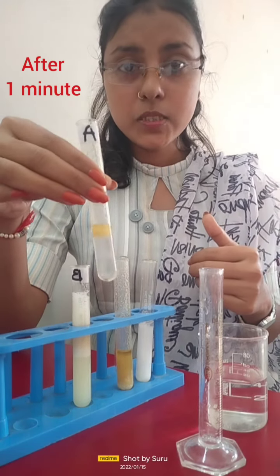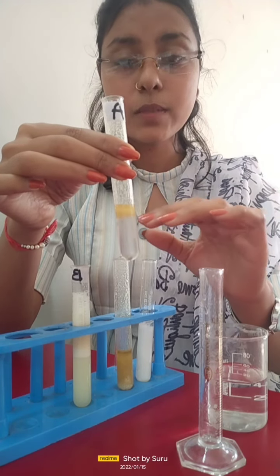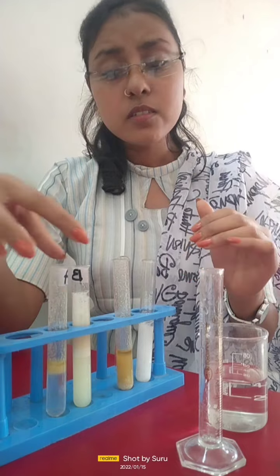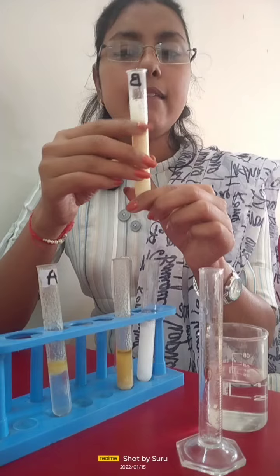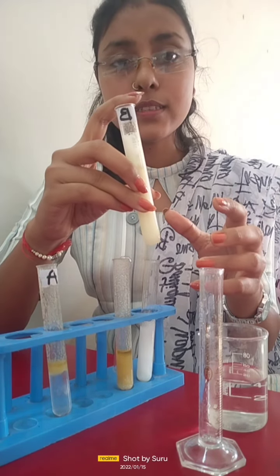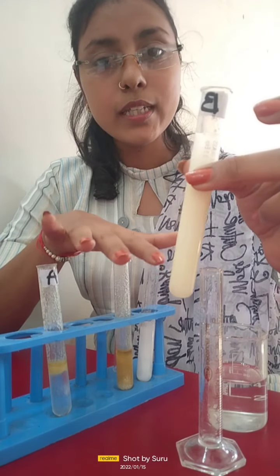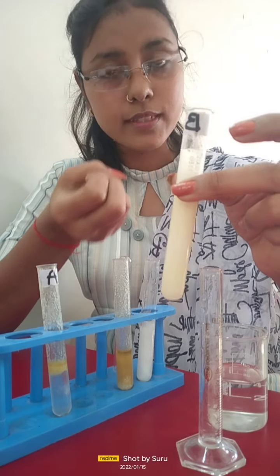In test tube A, we observe that there is a clear separation line between oil and water, which concludes that oil does not dissolve in water. Now let us observe the action of soap. In test tube B, we observe that a solution has been formed between the oil and water. There is intermixing between oil and water. You can observe over here, there is no separate line between oil and water. They have intermixed. This has formed an emulsion. This is called an emulsion.